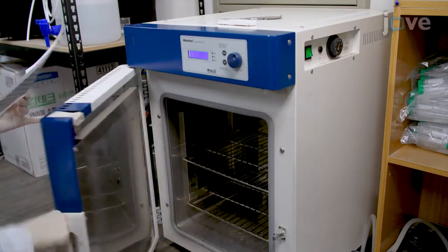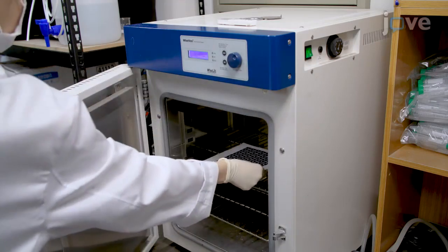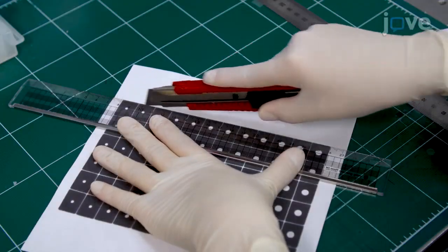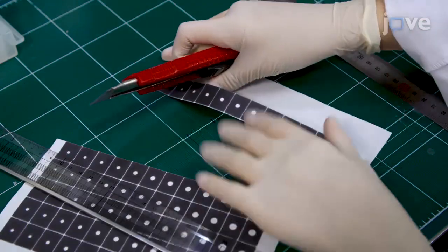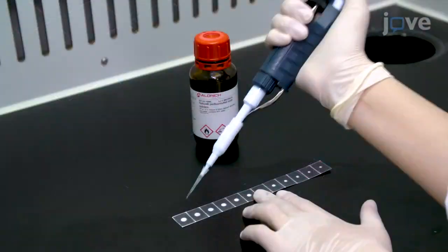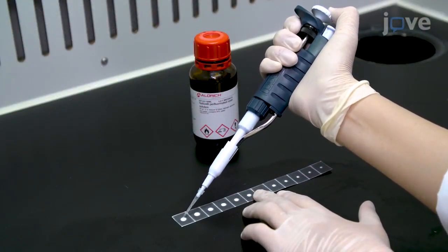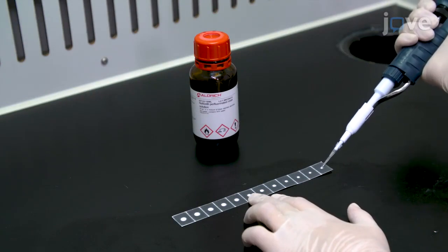Place the wax-printed paper in a laboratory oven for 80 seconds at 120 degrees Celsius. Then cut the wax-printed paper with a cutter to make individual ExoPad devices. Drop 5 and 2 microliters of perm-selective membrane onto the sample areas in the leftmost and rightmost layers, respectively.